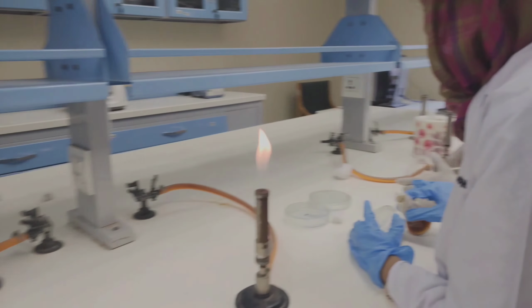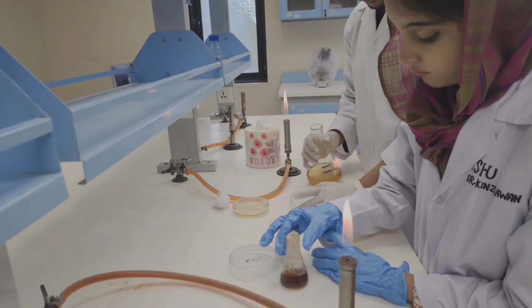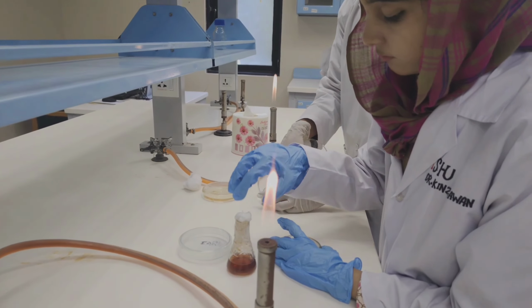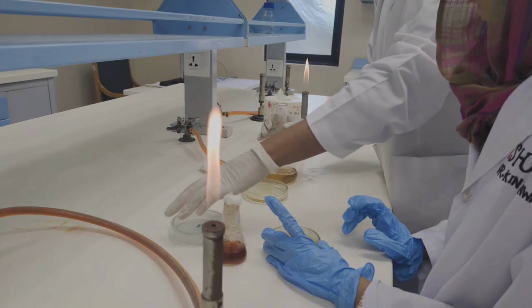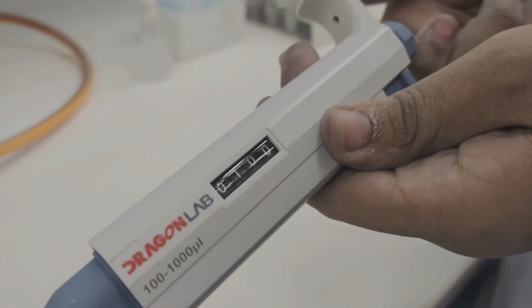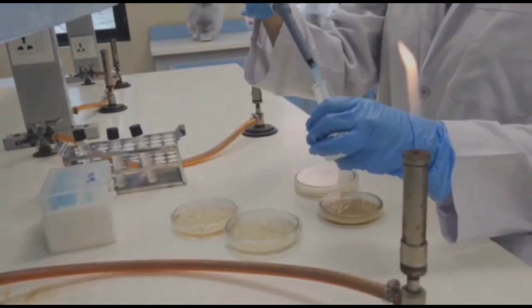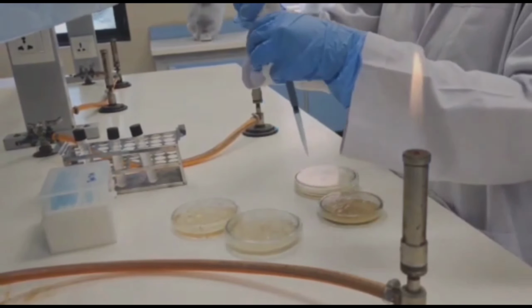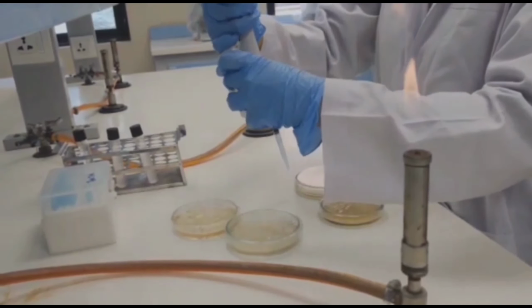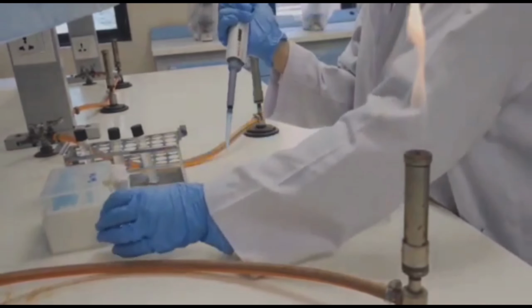Now our step is to inoculate media in plates. Now as you can see, we will inoculate and prepare dilution in plates. Now in this step, we will take a micropipette and first of all we will inoculate a sample, a solution of first dilution into MRS agar, in which we will check the presence of lactic acid producing bacteria.